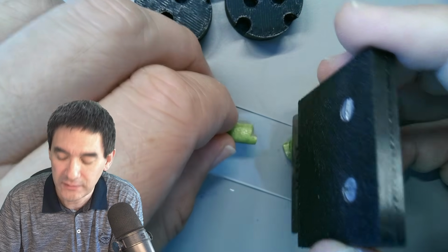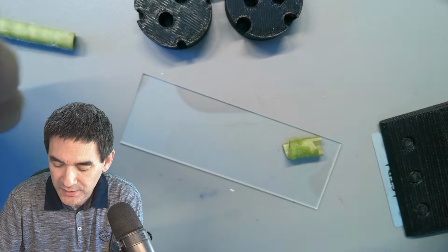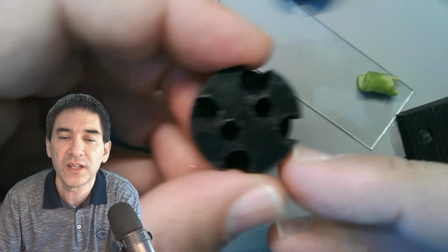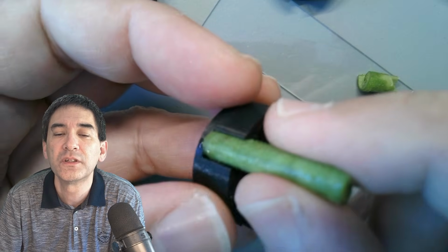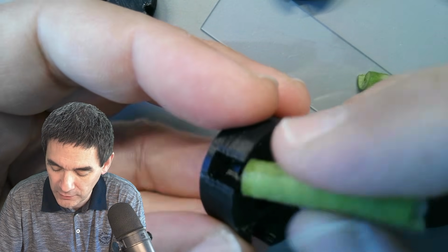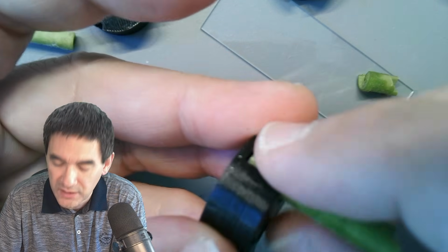Okay. Look at this. I was cutting diagonally. It actually doesn't really matter, because I'm going to put it into the specimen holder here in any case. I 3D printed this. And you see, for different cross sections of stem, I have different holders. This one is a little bit too big. It should fit fairly tightly, not too tightly. But this one seems to be fine.